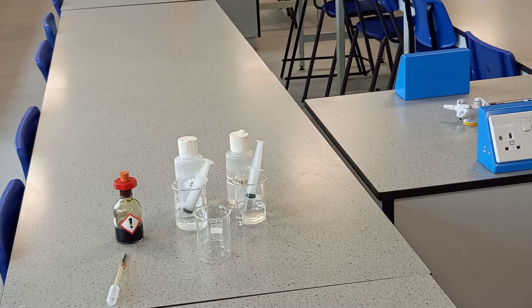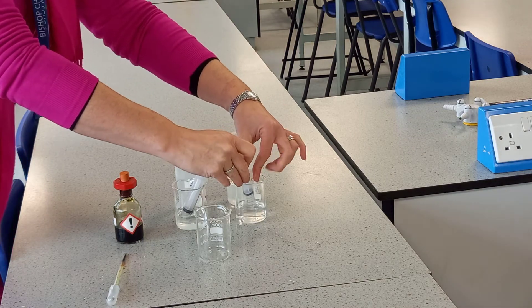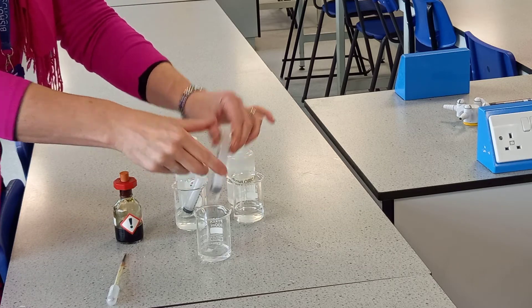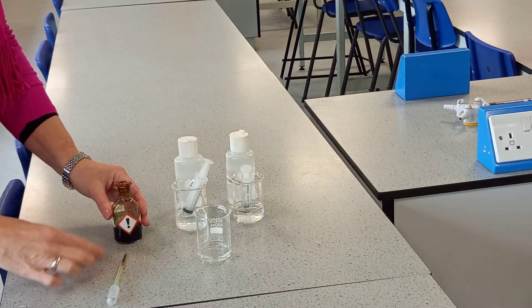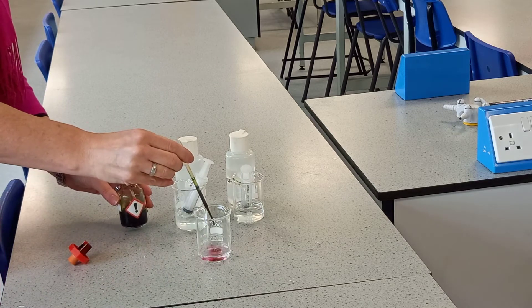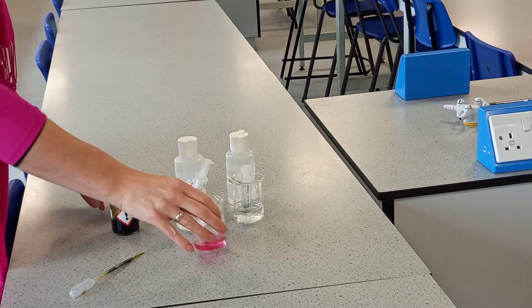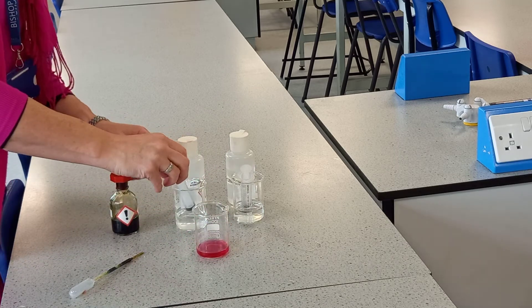I'm first going to add 10 mL of the hydrochloric acid into the beaker. I'm then going to add a few drops of the universal indicator. Now as you can see that turns it red — as we learnt in previous lessons, acids are red.